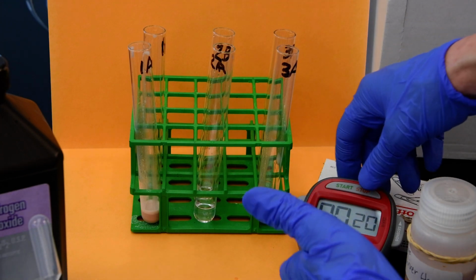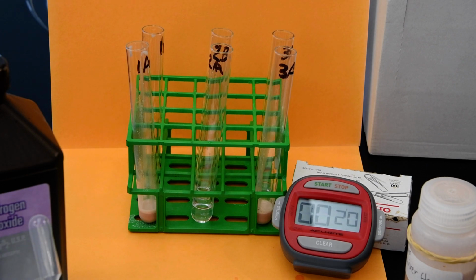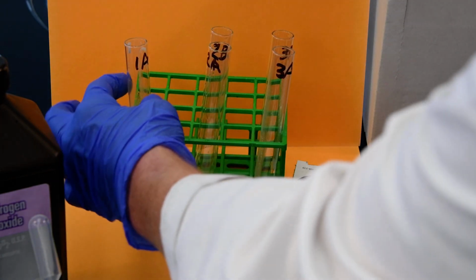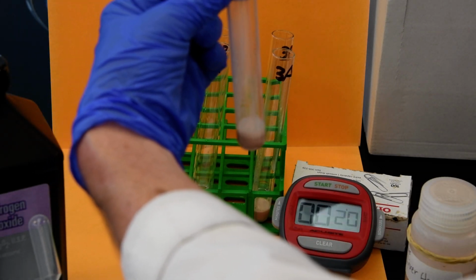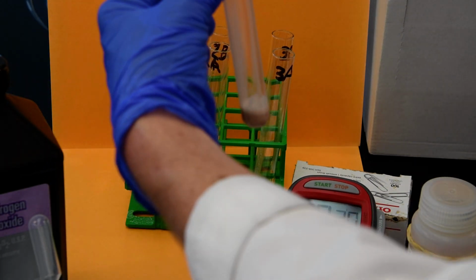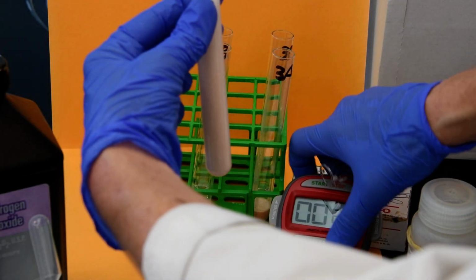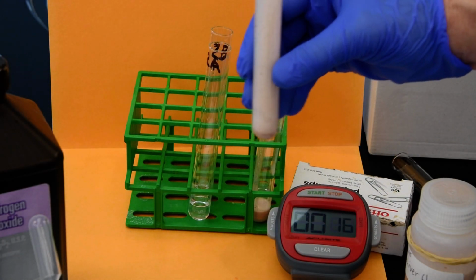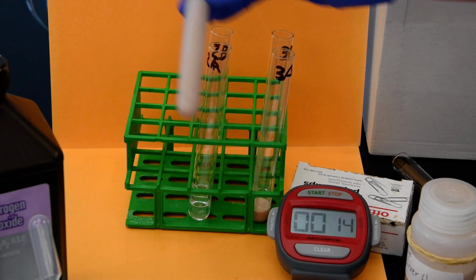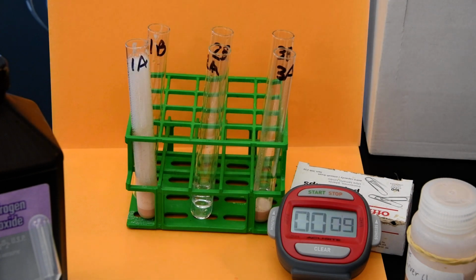So we let this reaction go for 20 seconds, so we'll just put the timer there. And what you do is you just mix B into A, all right? So I'm going to try to get my gloves out of the way here. So again, catalase and 1B, which we said has hydrogen peroxide. I'm going to throw those together, and whoa! Let it go for 20 seconds. And you saw this is a pretty instantaneous reaction. Getting my paper all wet. But we'll let it go for completion.